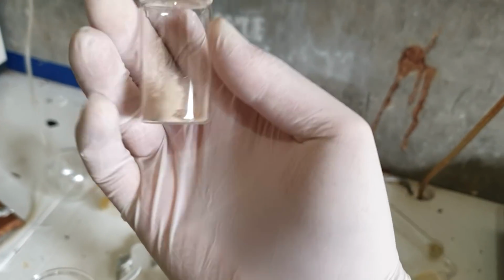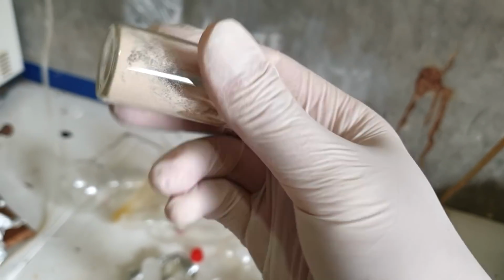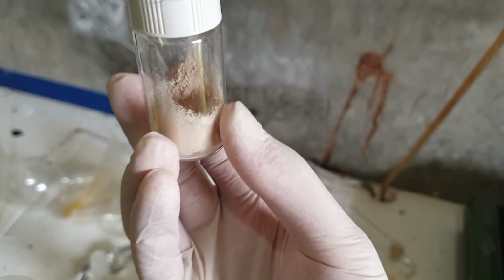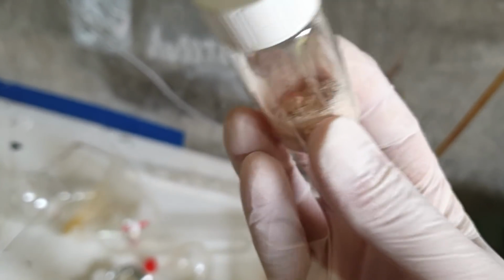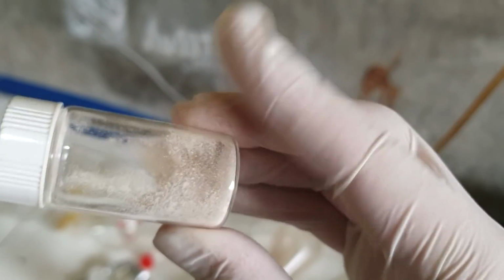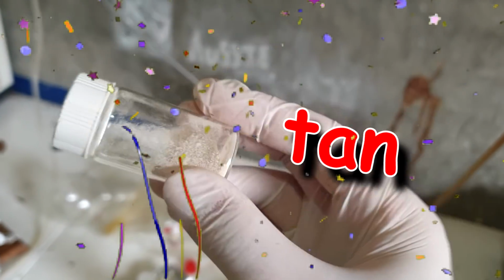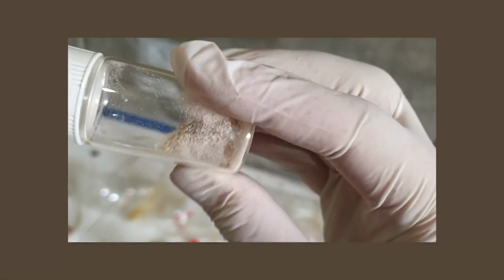So, point being is that we got this, and it's looking pretty nice. I mean, it's not brown. I wouldn't call it brown. Not very nice to call a solid a brown solid when you're looking for something colorless, as per the author's colorless product, but I'd go so far as to say this is tan, a light tan powder, maybe not light tan, just tan.